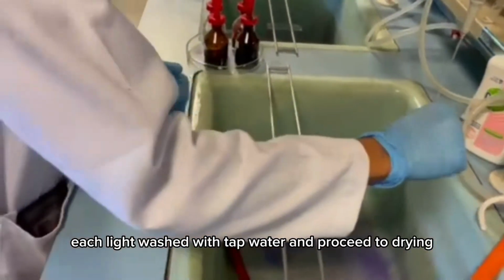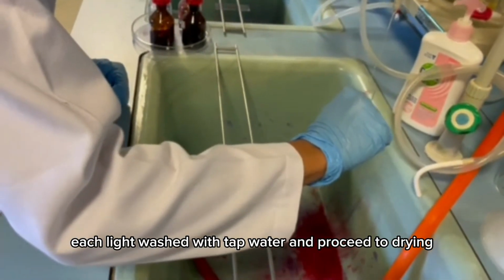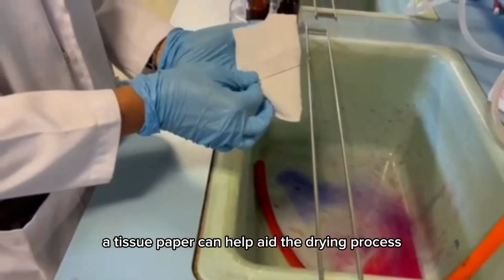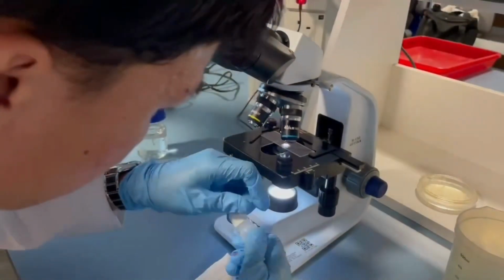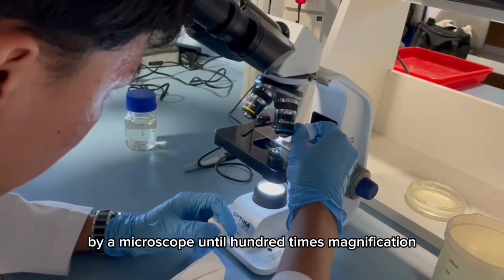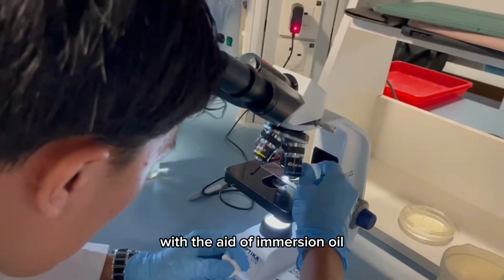Each slide was washed with tap water and proceeded to drying. A tissue paper can help aid the drying process. Lastly, each slide is observed under a microscope at 100 times magnification with the aid of immersion oil.